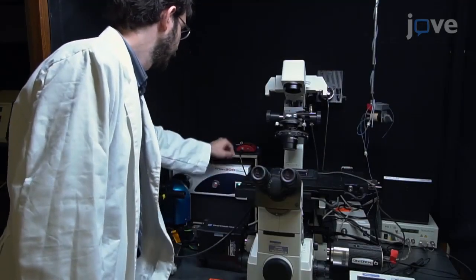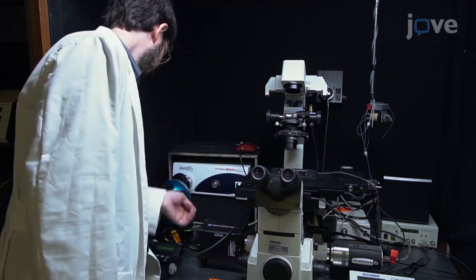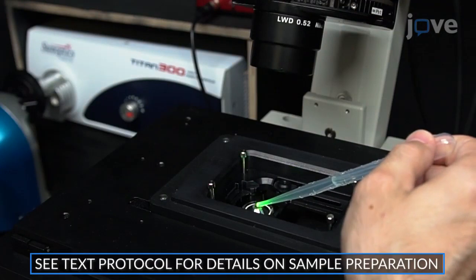To begin, set up an inverted fluorescence microscope and camera as described in the text protocol. Then, load the sample on the stage.